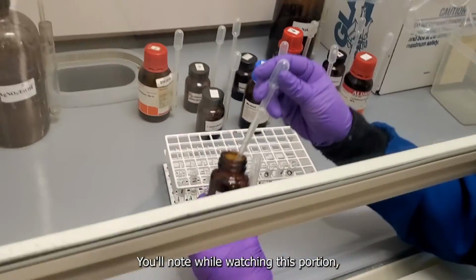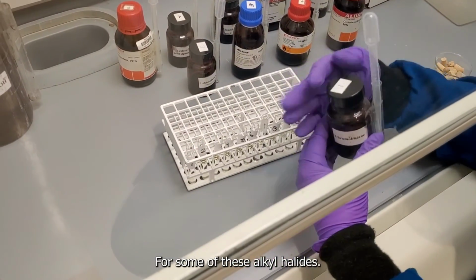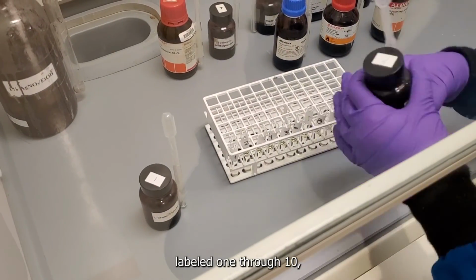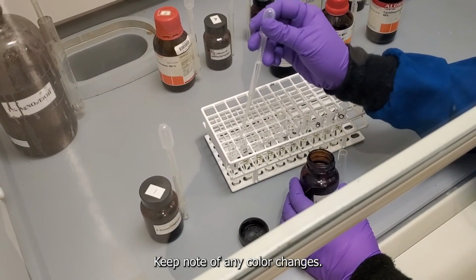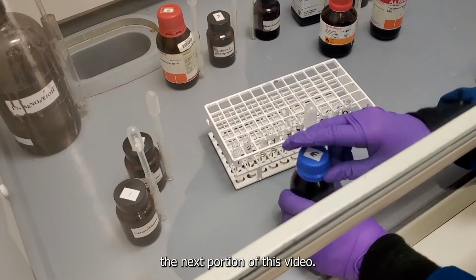You'll note while watching this portion that precipitation occurs immediately for some of these alkyl halides. The tubes are labeled 1 through 10, so you can approximate which tube is what. Keep note of any color changes. And for your convenience, I have fast forwarded the next portion of this video.